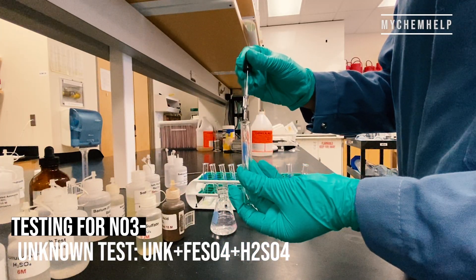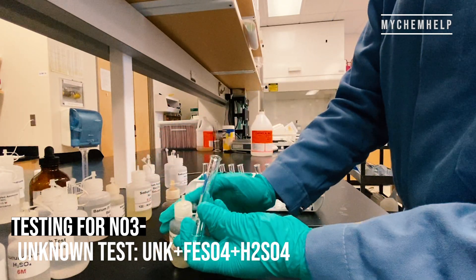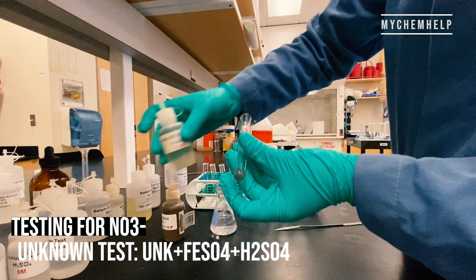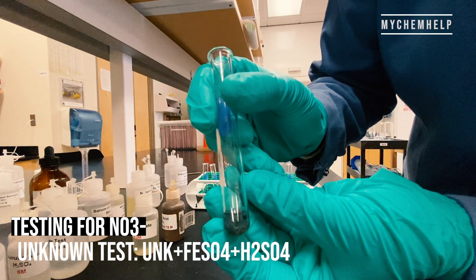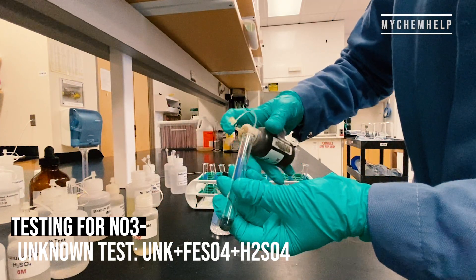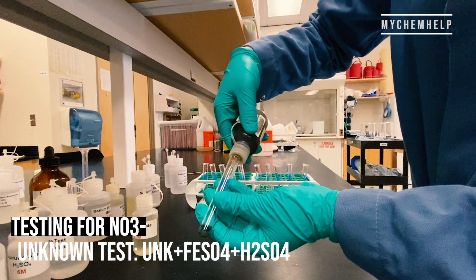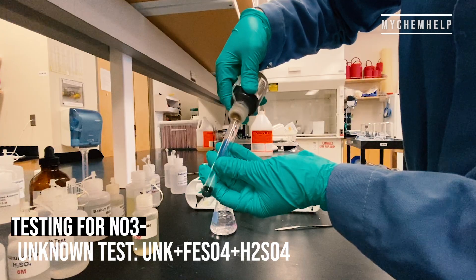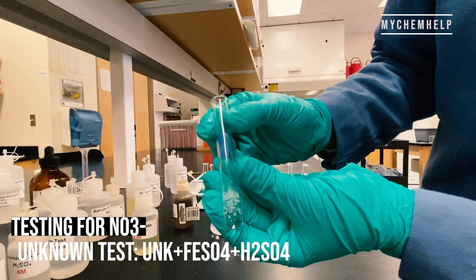So here goes our unknown test. We've got our unknown followed by the iron sulfate — a really different reaction than what we saw in the first place. Last step with the sulfuric acid. As you can see there was a violent gas evolution, and actually the test tube got really hot to where I couldn't even touch it at the bottom.